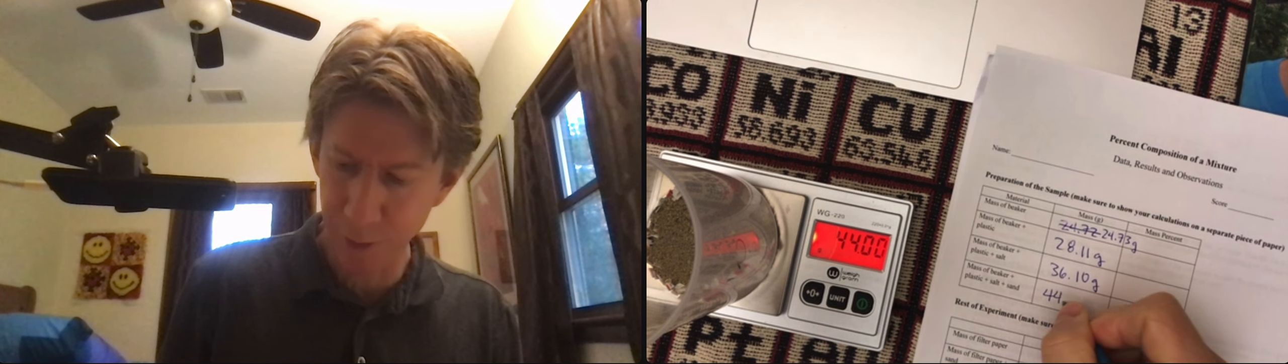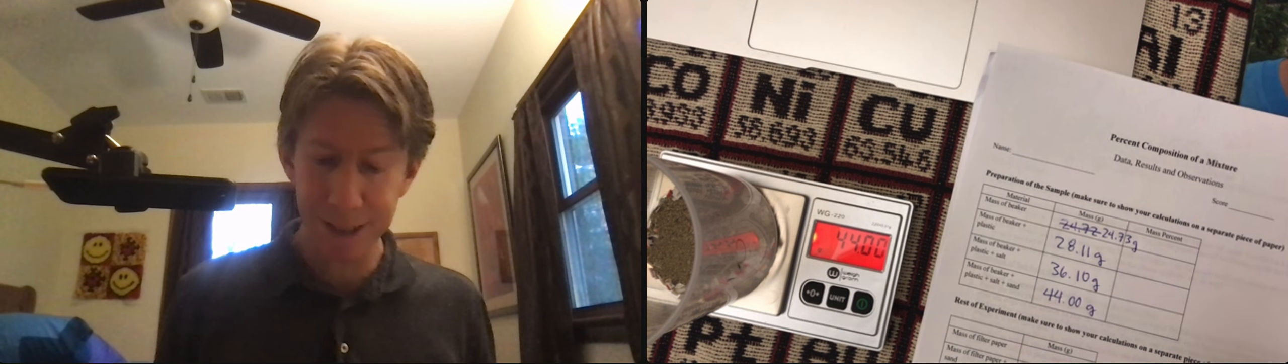Nice round number there. 44.00 grams. Can't help myself, I wrote my units in anyway. And that's going to be our sample.